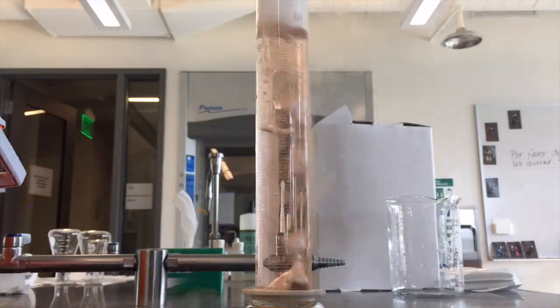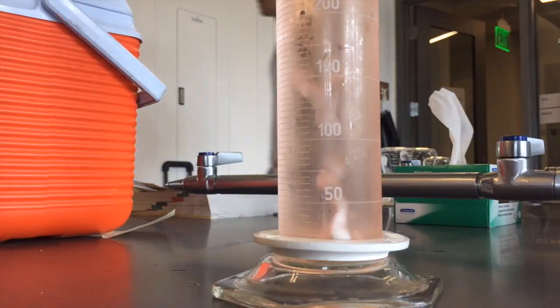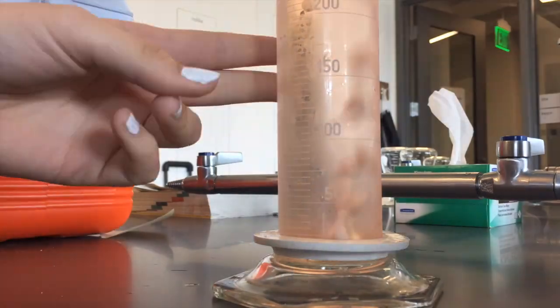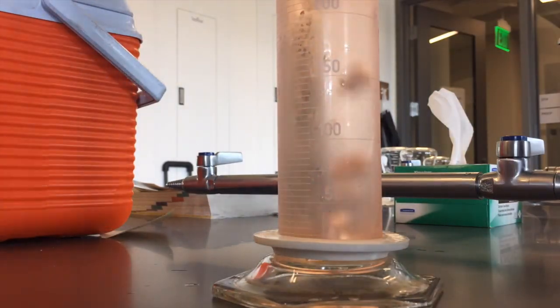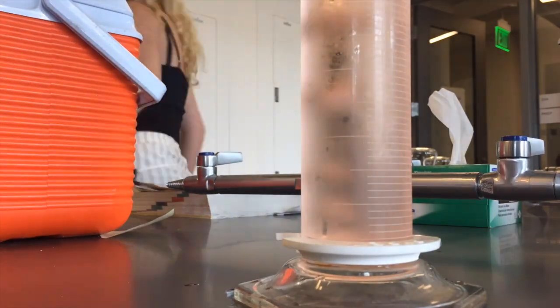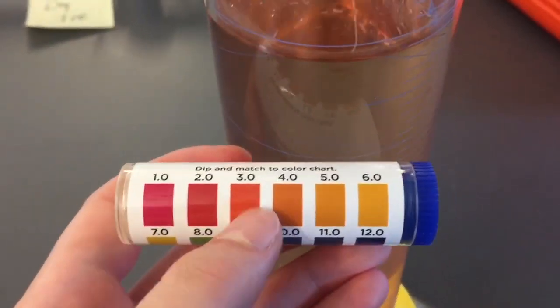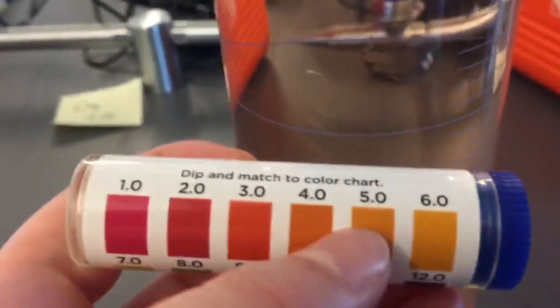Changes happen very quickly and then much more slowly, so we will use a time lapse to watch the changing of the colors. We will then compare the color of our final solution, where no change has occurred in color for a significant period of time, to the color reference sheet included with our universal indicators provided, and determine the pH of the final solution. The rusty orange color produced indicates an acidic solution according to the reference sheet, as shown above.